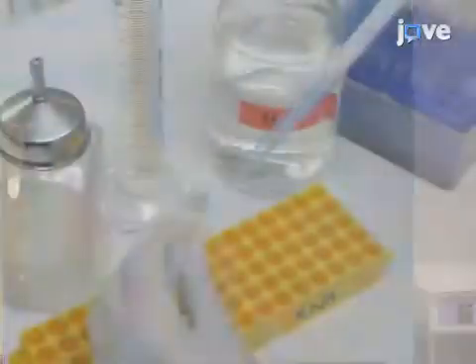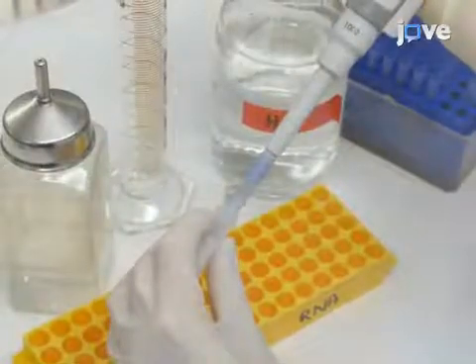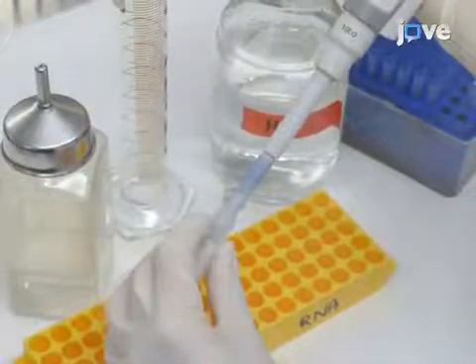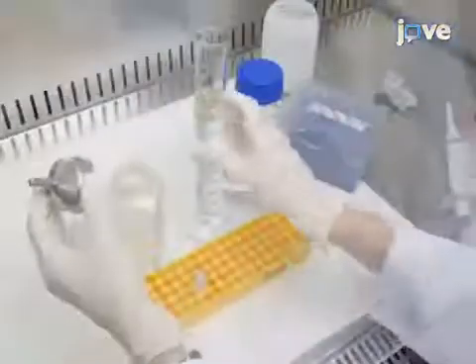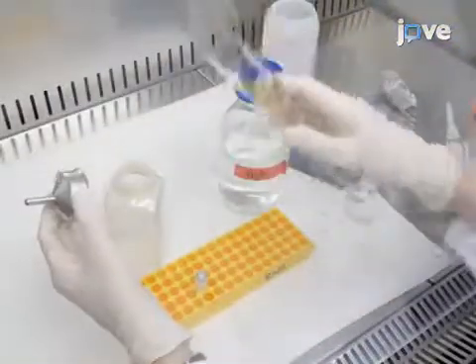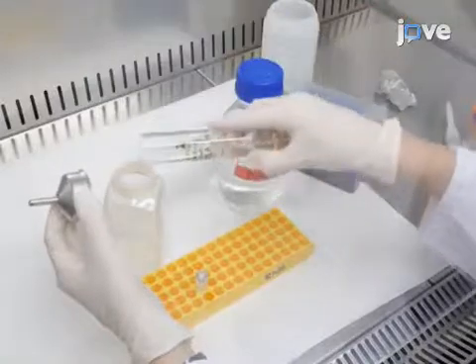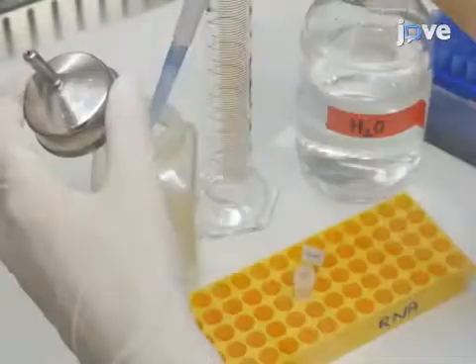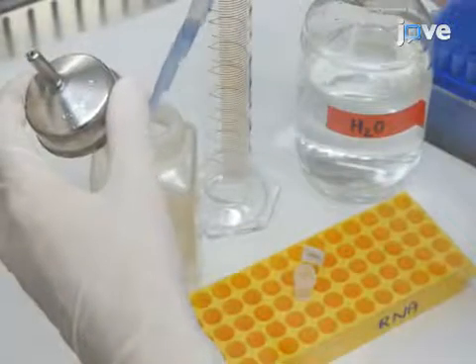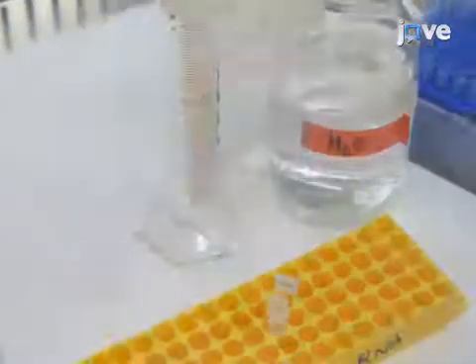To prepare bacteria-containing drinking water, use 100 milliliters of sterile filtered drinking water to dilute the cells from each bacterial stock culture for a final average of 10 to the ninth per milliliter CFU.